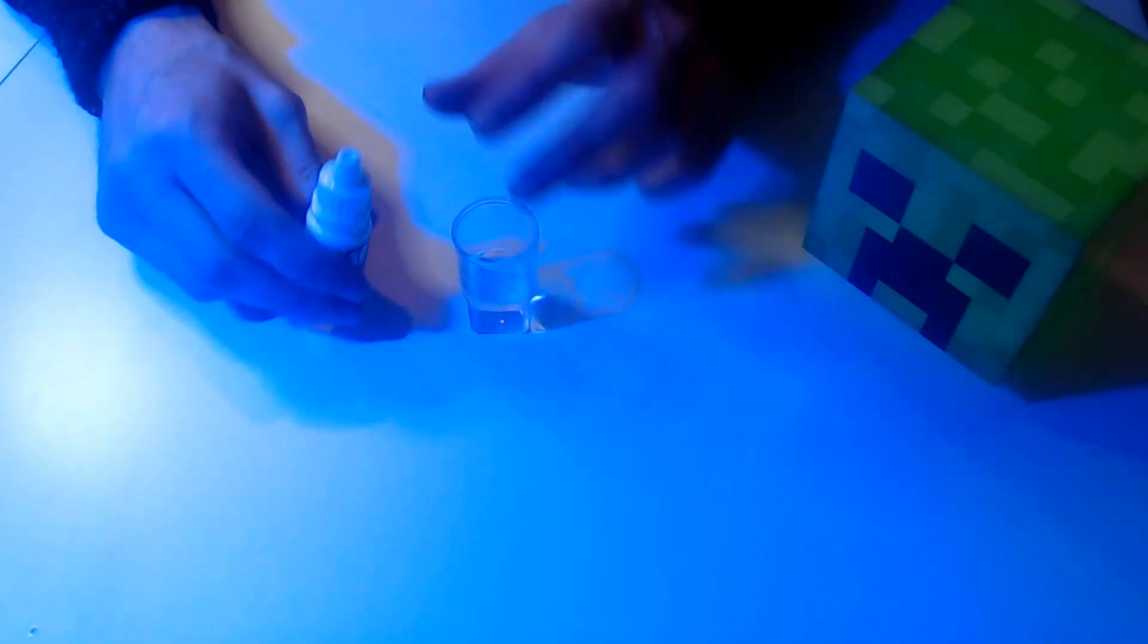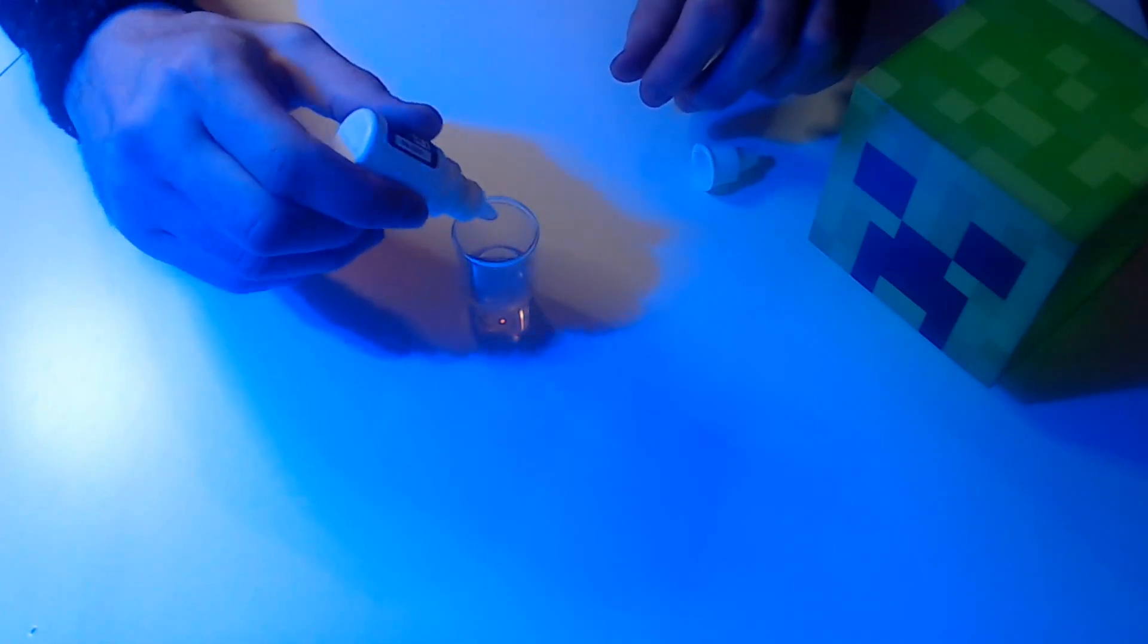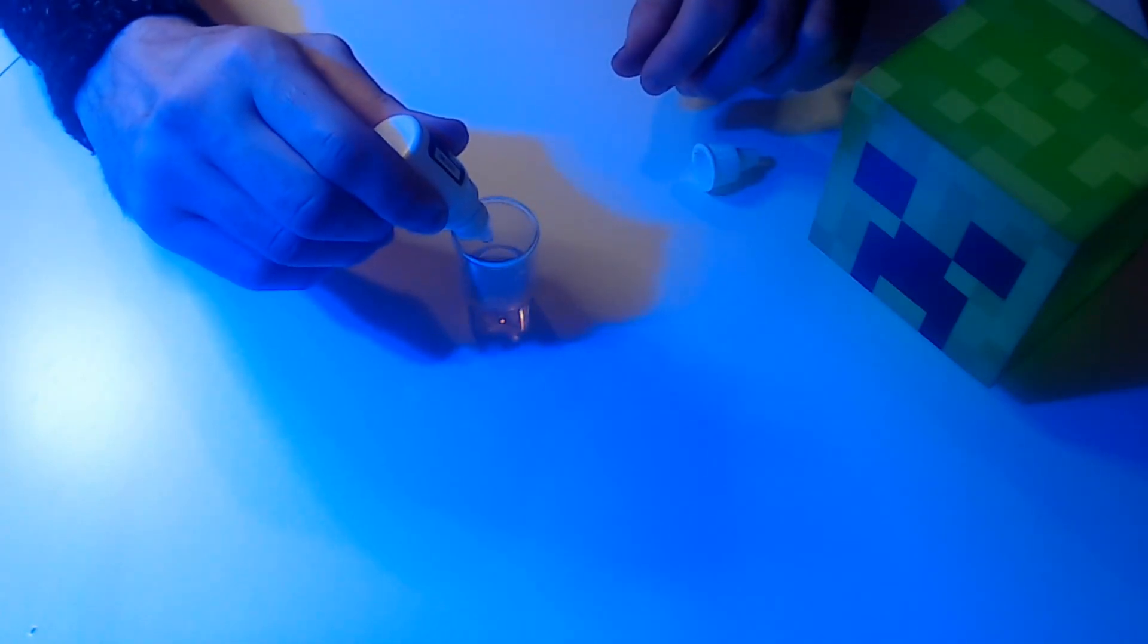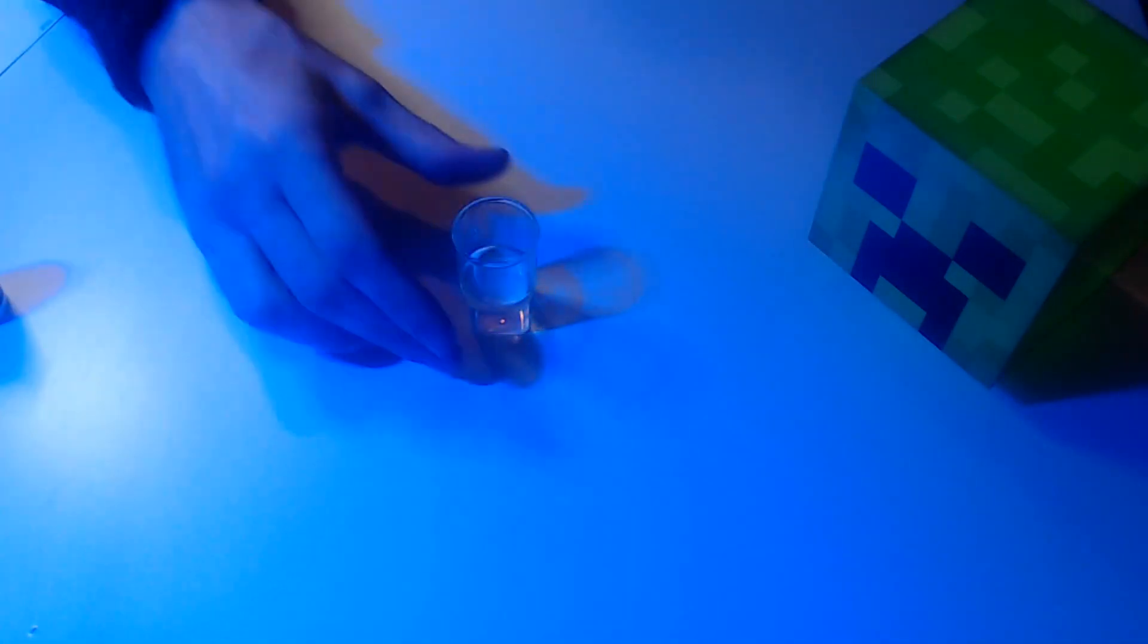Next stage, your drops. You want to put 4 drops of solution into the water. 1, 2, 3, 4, and you want to give this a quick shake for 10 seconds.